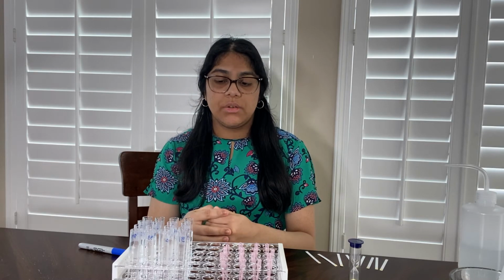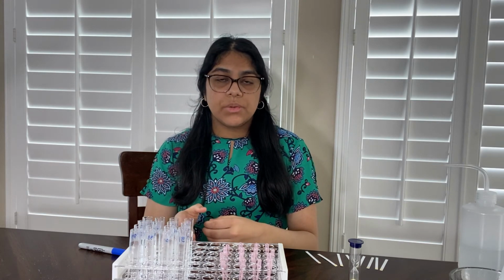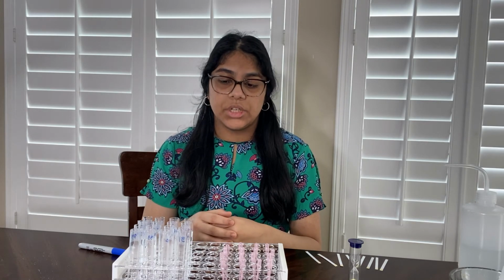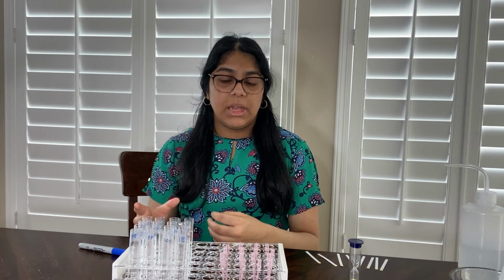In addition, we're not only going to have one infected sample, but 2, and these infected samples are actually going to be represented using glucose solutions of different concentrations, meaning one individual sample will have a higher concentration and the other individual sample will have a lower concentration. And this will kind of enable us to simulate how the situation would be in real life, where one person may have a different viral load than another person may have, even though both may need to be tested for this disease.